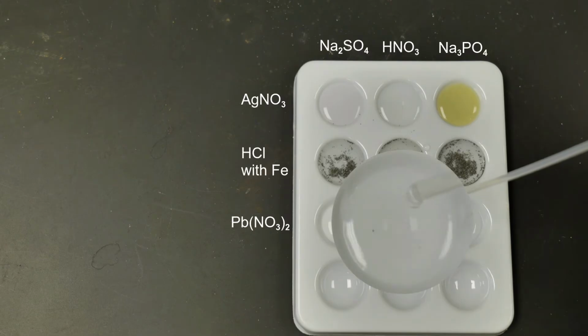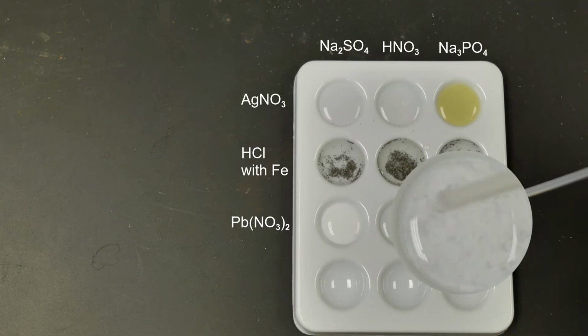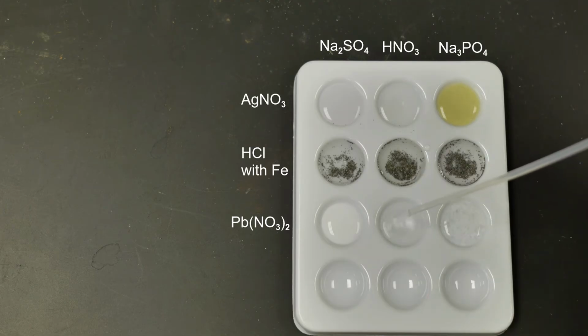Let's add it into the nitric acid. Do we notice any change there? Let's add it into the sodium phosphate. Do we notice any change occurring there? So again, let's make sure we add enough in each one.